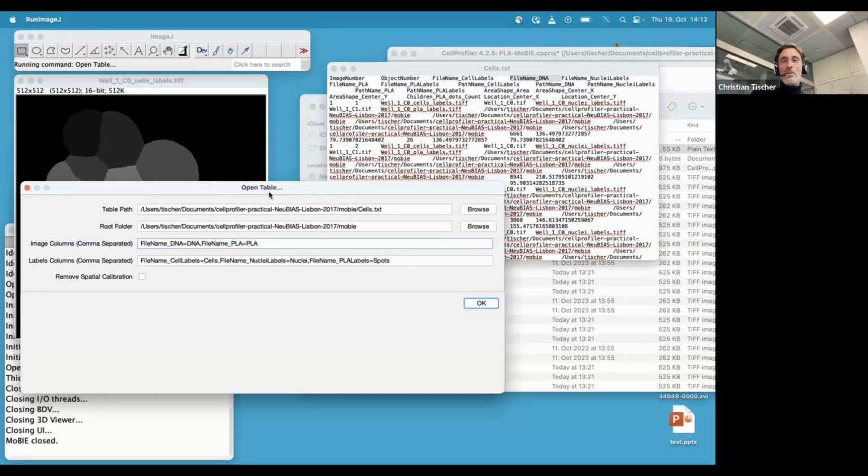If you all now really love this and want to use this a lot, write it in the forum thread. I could then add more convenience to specifically open CellProfiler tables, but I try to keep it generic because we also produce such tables with a lot of other software, as mentioned. So, okay, then you have to just tell it which are the columns that contain images and which are the columns that contain labels, so segmentations, right? This is something you have to specify.